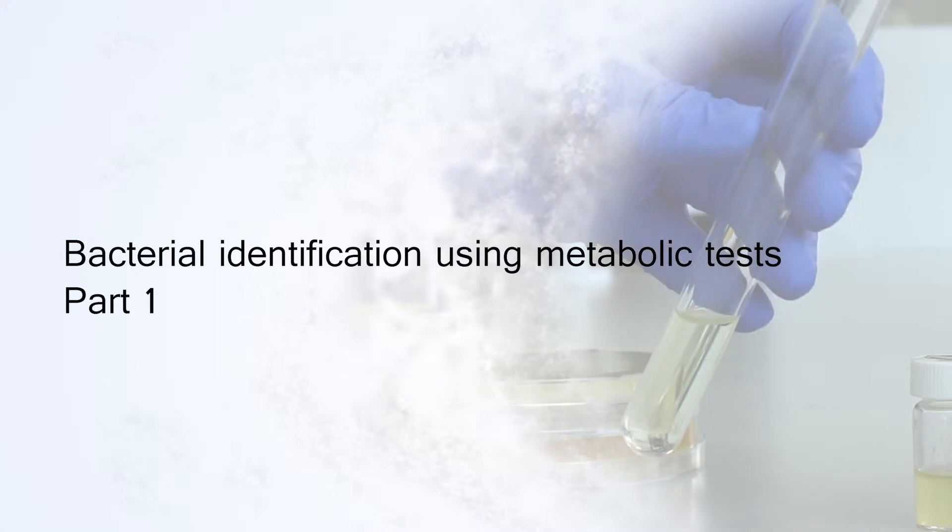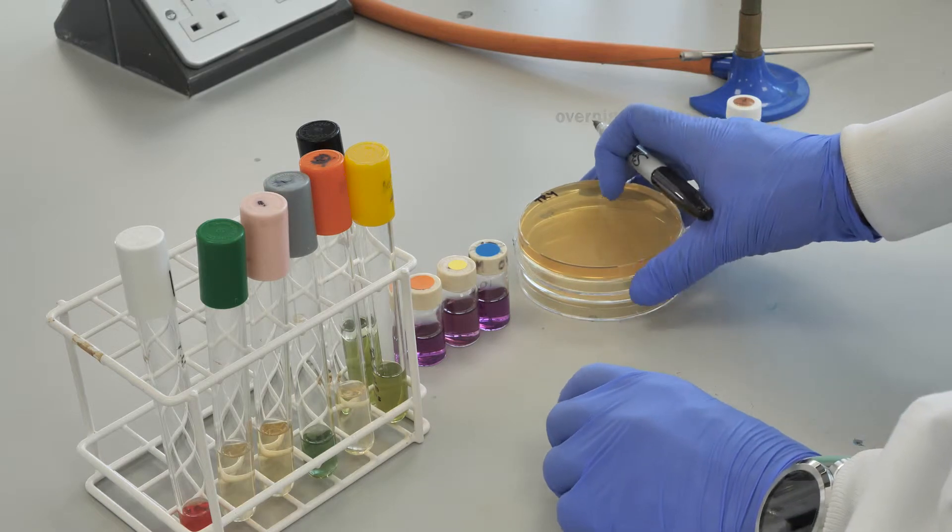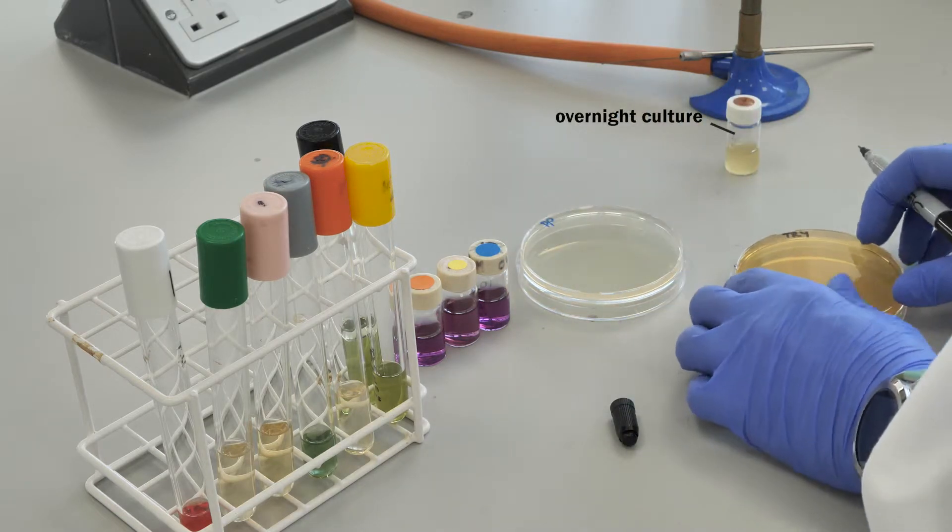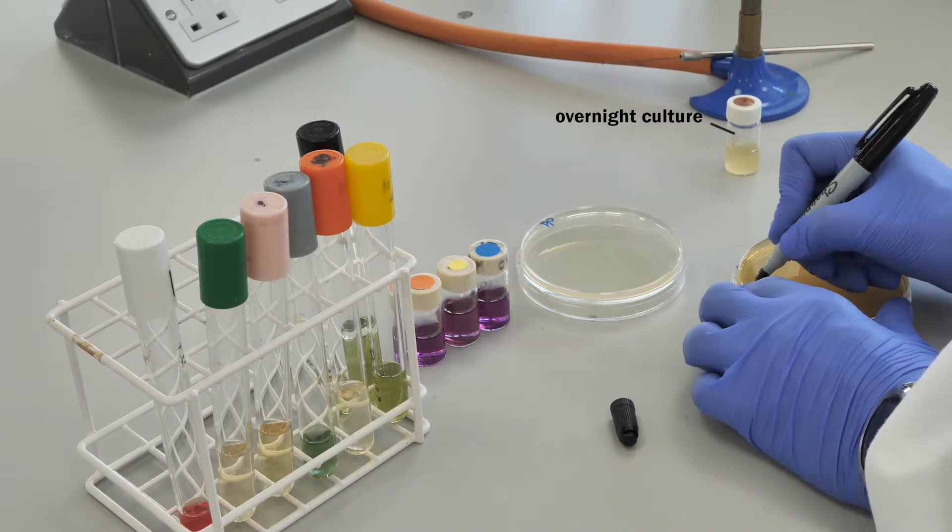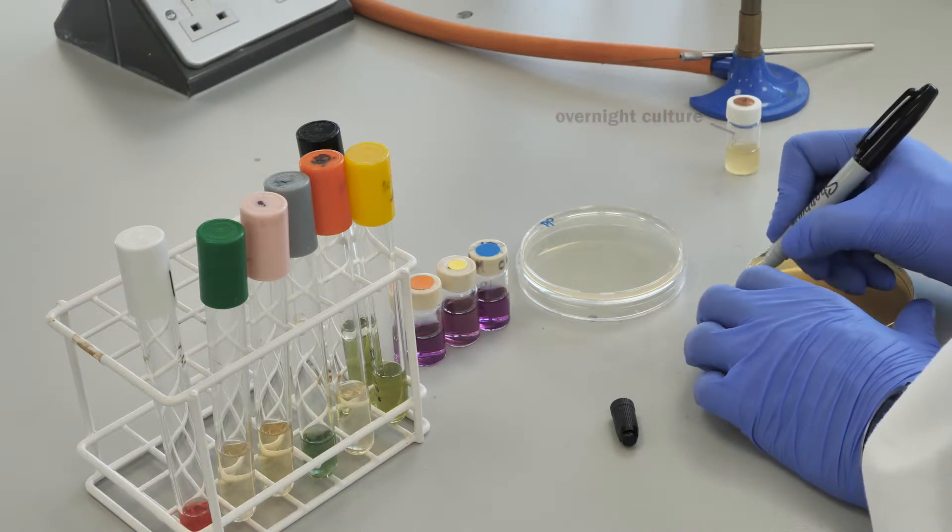Biochemical test setup. An overnight broth culture is provided. A series of tests are set up to determine the bacterium's biochemical properties for bacterial identification.